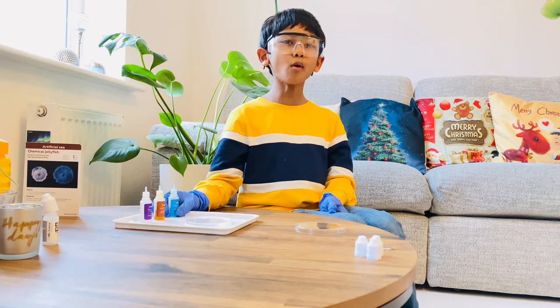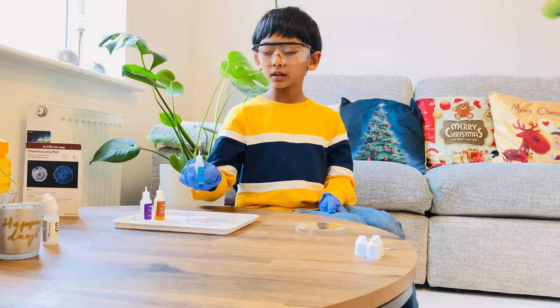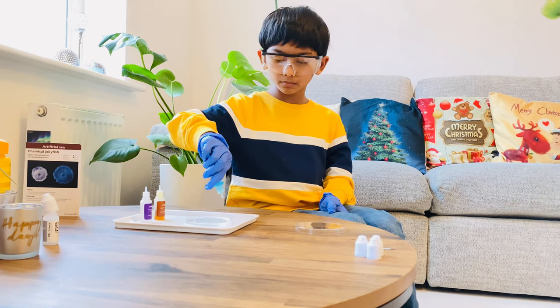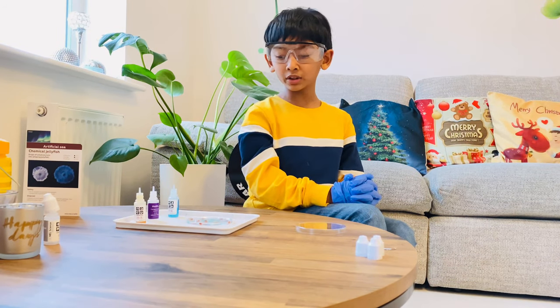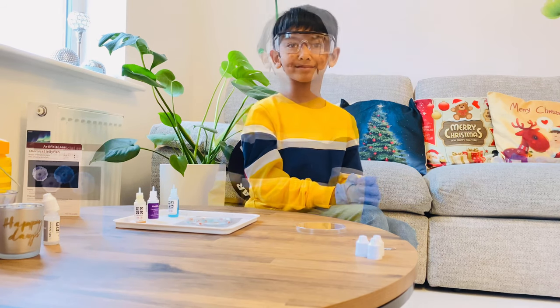You open the other bottles with the pin opener, and now I'm going to drop copper sulfate into it. We've dropped some of these solutions in and we're going to wait for three minutes.